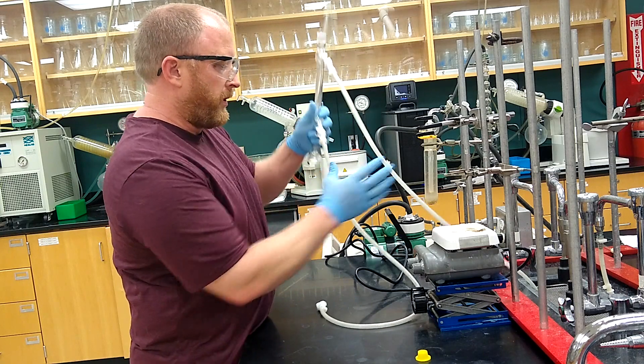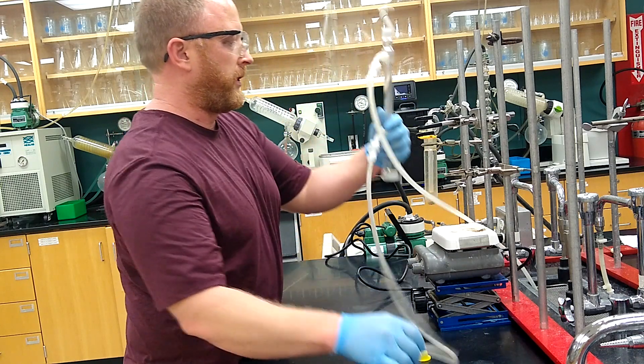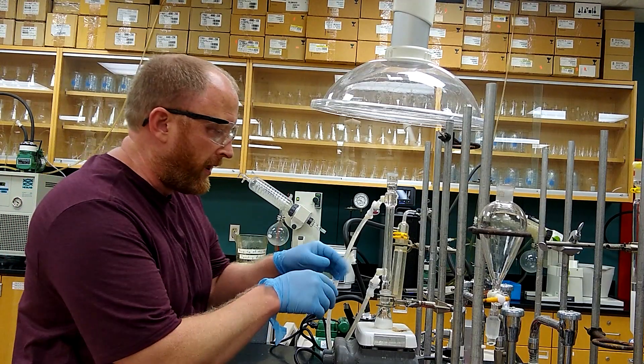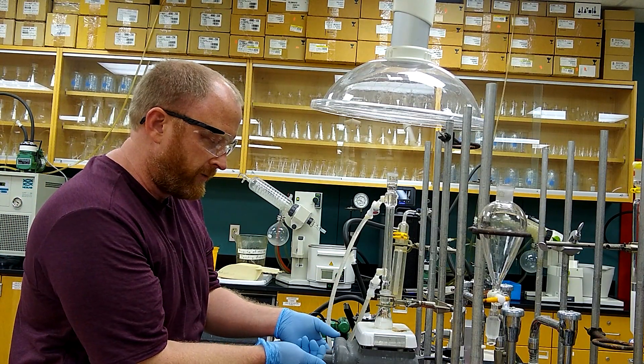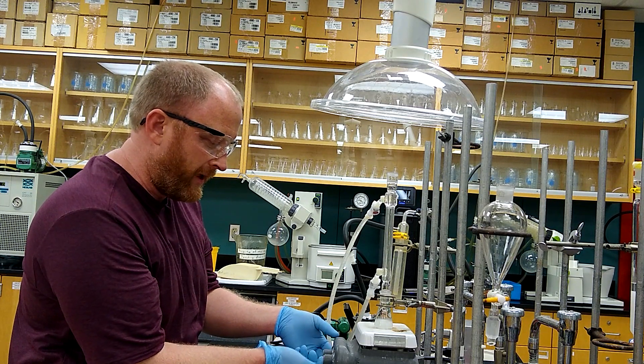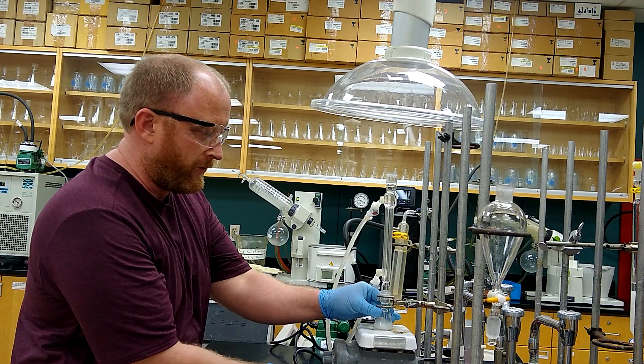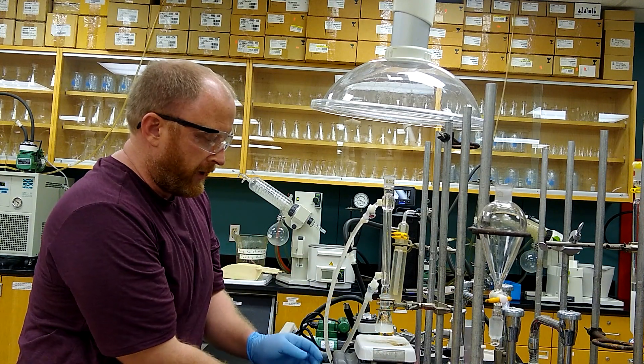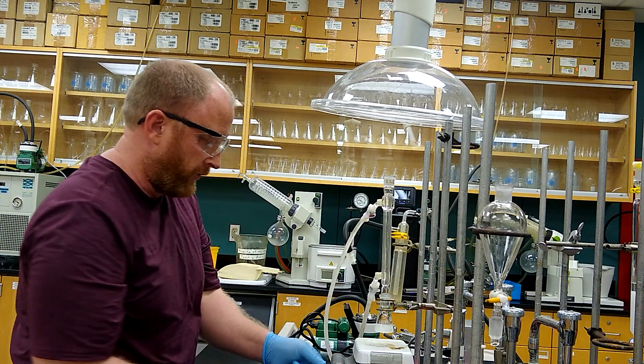If you already remember how to do this, we've already got it set up. After the reflux is done, I'm just taking this off, turning the heat off, and removing the reaction from heat, and then we'll just be letting that cool at room temperature.